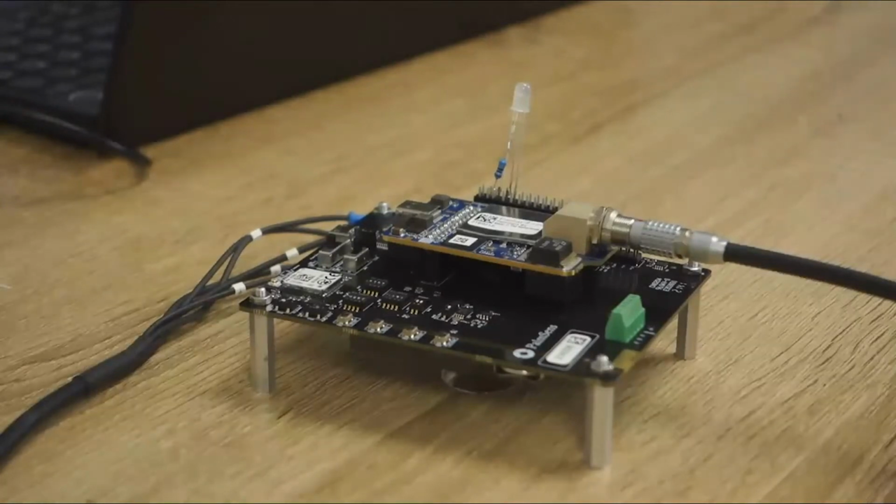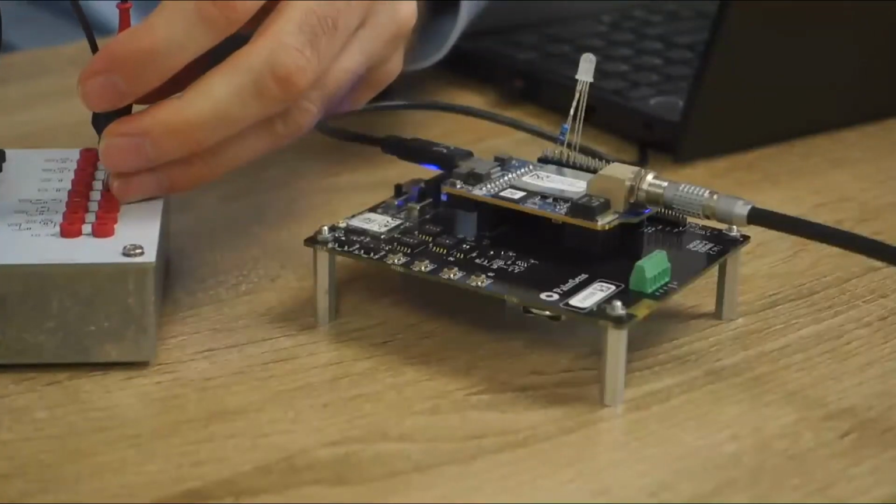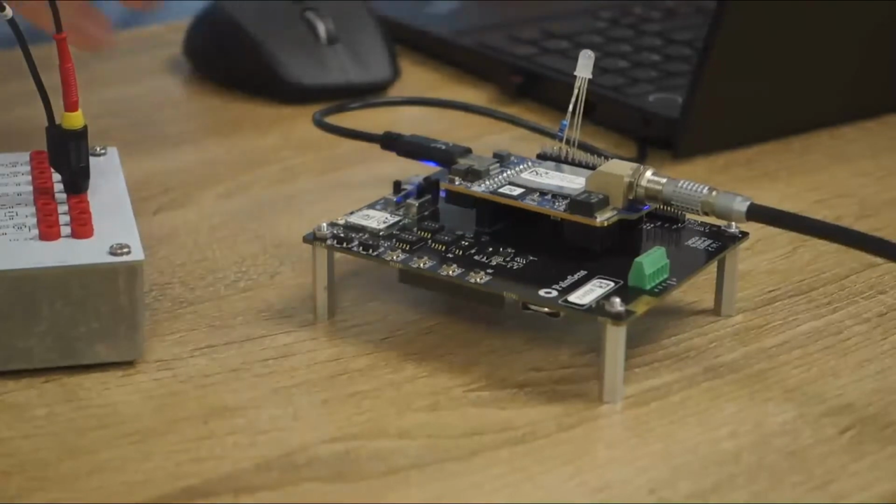But we're not going to do that with the Sensit BT. We're not going to do this with the Sensit BT, correct. This test, we're going to connect to the EmStat4 dev board. You can run more or less the same scripts on both. Some of the GPIO pins and other hardware-specific things might be a little bit different, but the script itself should run on both devices. Right, but the pins are here nicely available on the development board, so you could easily solder the LEDs to it, right? Yes, and this is what we've done.